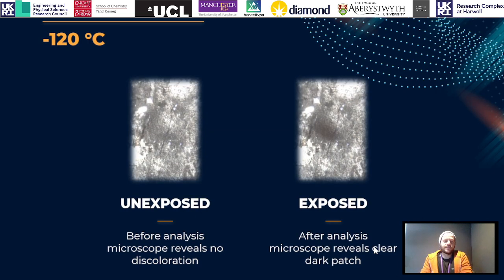So to visualize that a little bit, the first image we're looking at here, at minus 120 degrees, so very cold, we've just taken an image from the internal microscope on our Kratos Supra system before and after an extended exposure to X-rays. And if you look closely, you can see a dark discoloration on the exposed sample. Now this is obviously where our beam is hitting the sample, and it's the first visualization that we can see that we're doing something to our sample that is obviously not great. We're changing it, and of course first rule of any measurement is you don't really want to be changing what you're looking at.